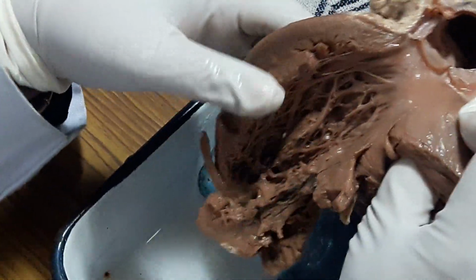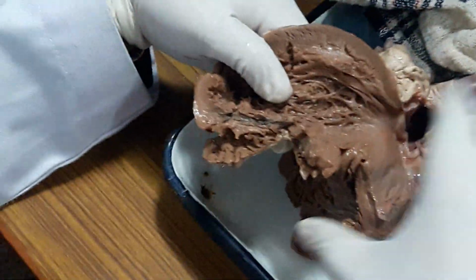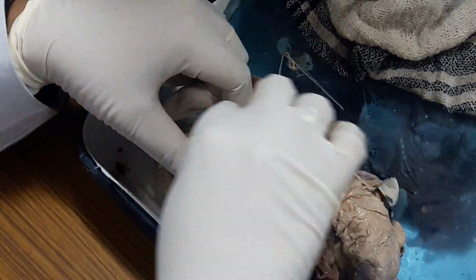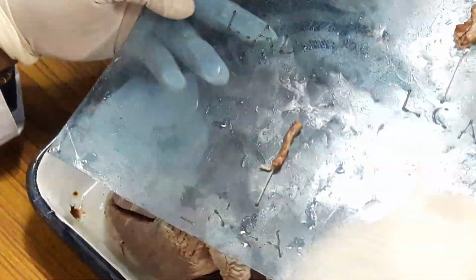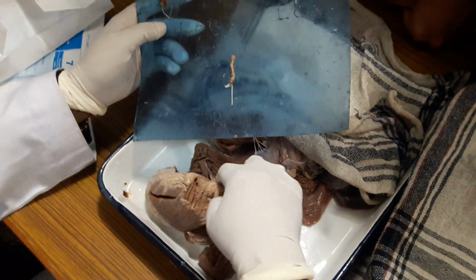See? Actually, sections have been taken and the heart is pretty old, so that's why it is very difficult to differentiate at times. But you can appreciate the alteration in color in the myocardium. Now, if you see this kind of infarction, you have to see the extent of the infarction, and then you have to see the subtending artery. Arteries have been taken out from the bed, and this patient had atherosclerotic occlusion. Now it is very difficult to tell, but once you take a cross section, you will be able to see atherosclerosis. Okay, and there was significant atherosclerosis involving the LAD.